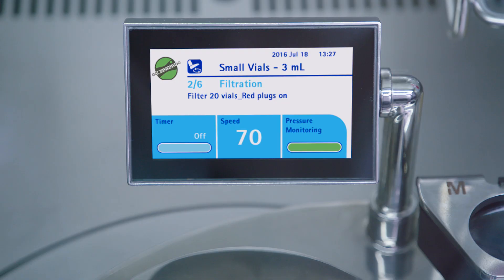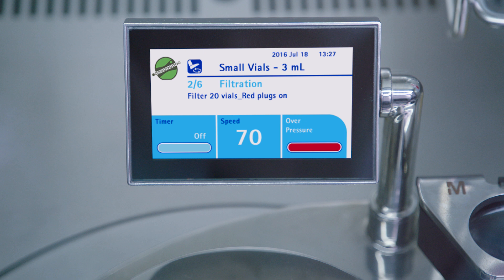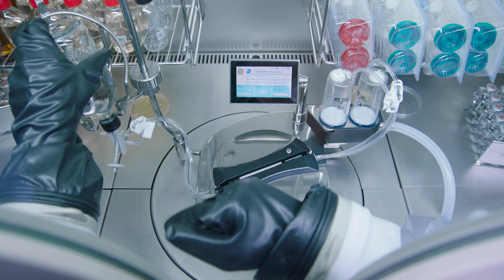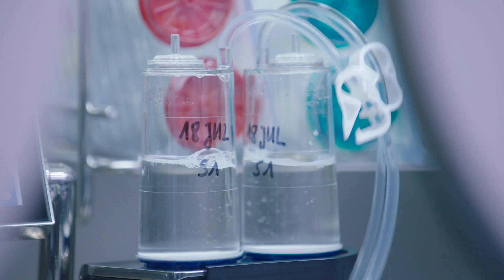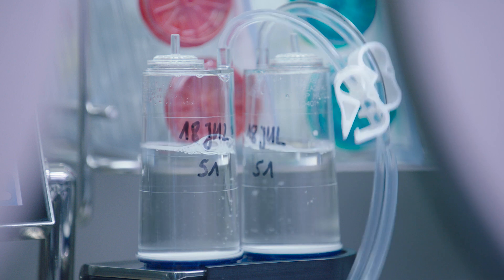Two pressure modes, both of which include automatic pumping speed reduction, alert the operator, reducing the risk of test interruption and minimizing stress on any microorganisms that may be present. Eliminating product residues from the filtration device is key to prevent false negative results. Appropriate rinse fluids and correct rinsing procedures are essential for success.